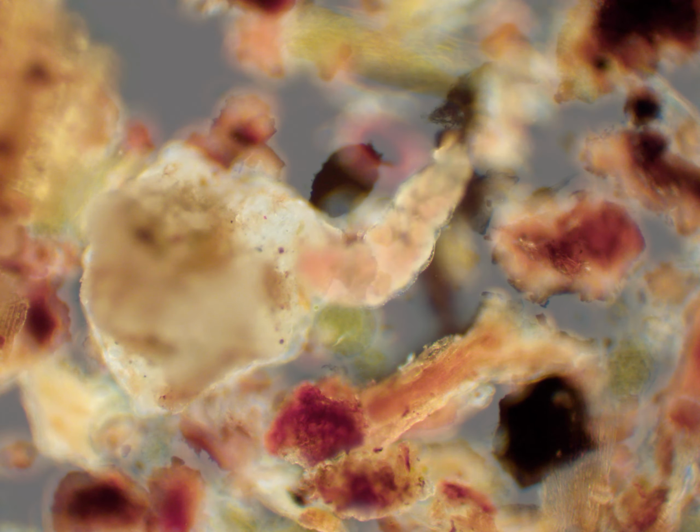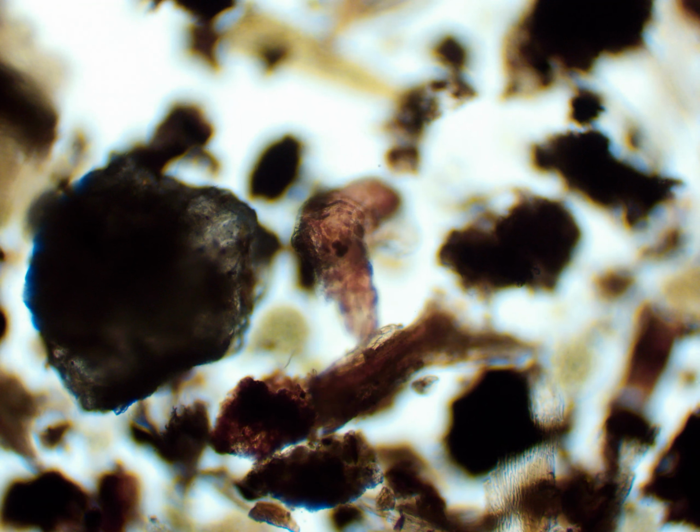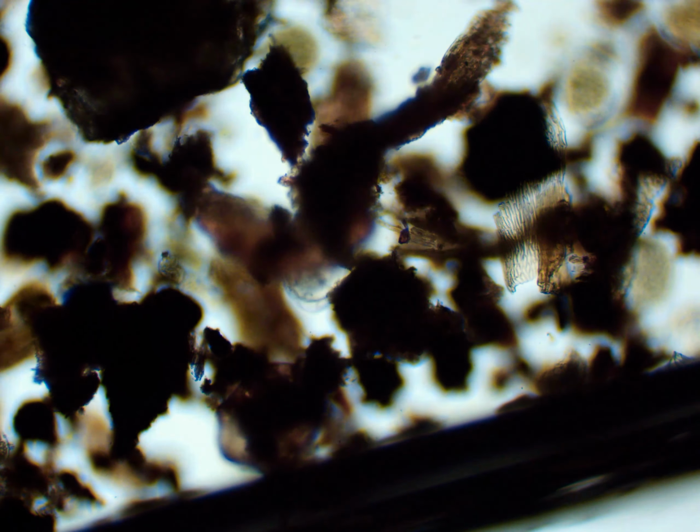All of those segments have small amounts of pigmentation, I should say, but you can really see those segments and the pigments in brightfield here, where you can see it climbing around the sediment. It caused a lot of disruption to the sediment since it's so large, especially compared to a lot of other organisms around here.